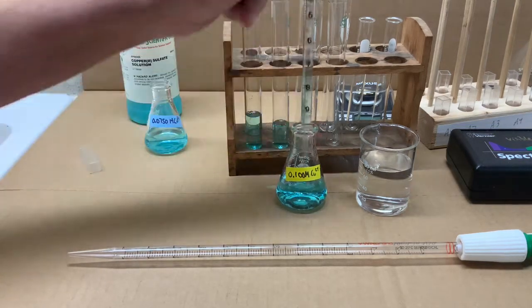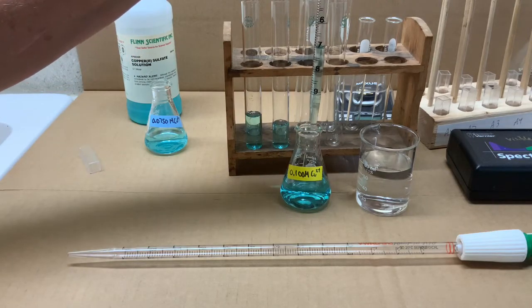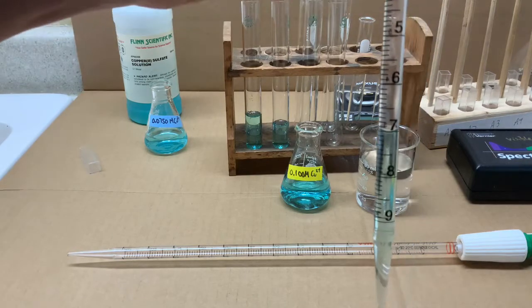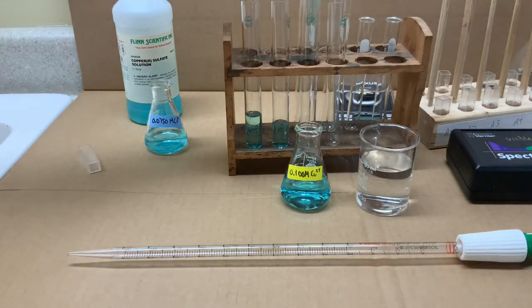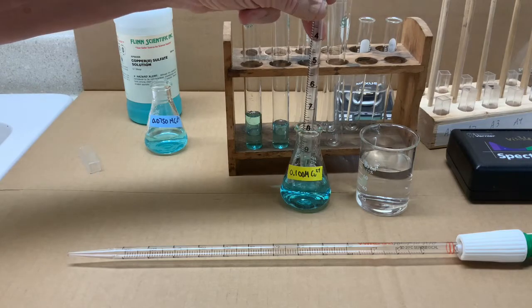For solution 4, which will be 3 milliliters of stock solution, drawing up to the 7, releasing all of the solution, including the last milliliter in the tip of the graduated pipette.